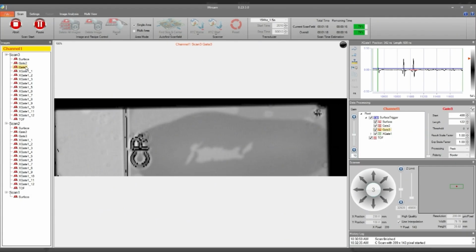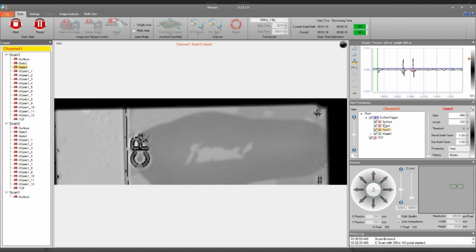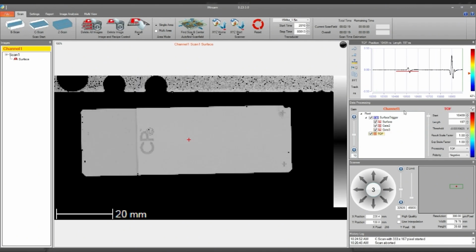Here we can also see the bond interface echo image. And in this image, we can see the voids and we can see the other regions that are well bonded. And this is an image of the time of flight thickness map. This shows you basically a topography of the voids within the bond layer itself.